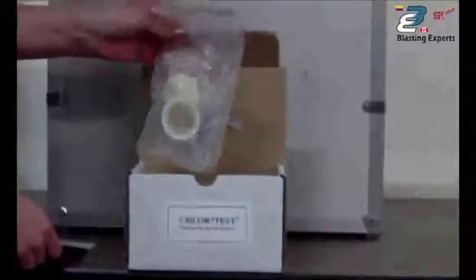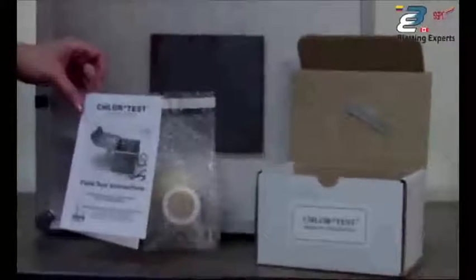There's five little bubble bags in there that contain everything needed for an individual test. Five of those bubble bags, and then there's the directions. The directions do cover each step of the procedure precisely. It is important to read those directions, so please do.